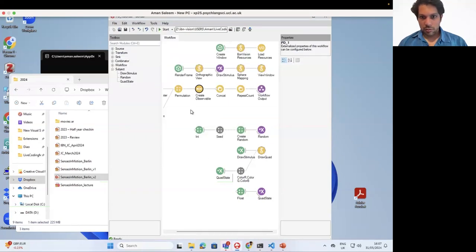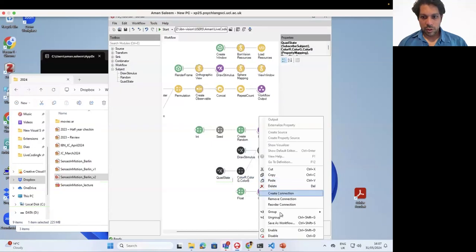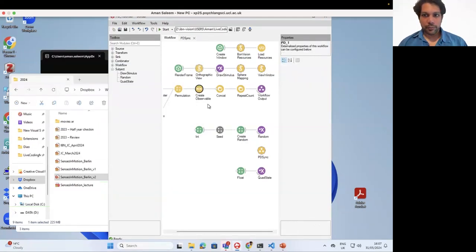So just to clean up this code, this one I can just put as a group, and I can call this PD sync. So that doesn't actually change anything. It's just got this code inside, and it's just activated every time. You can put this update PD at any point of the code, and that would do it. Right? So just going to save that.